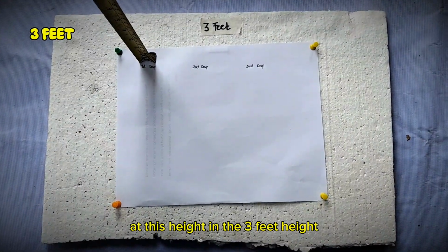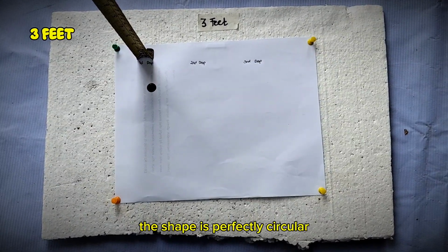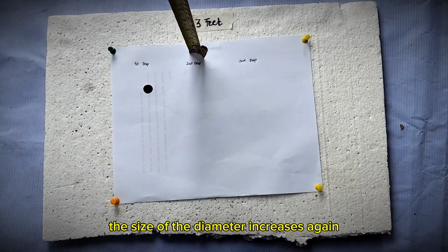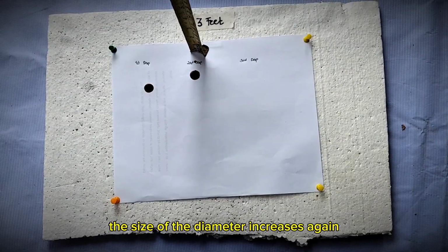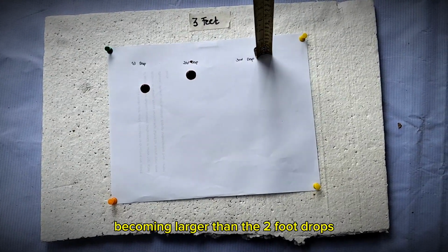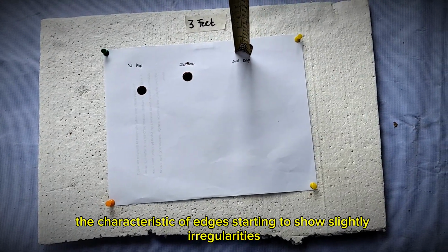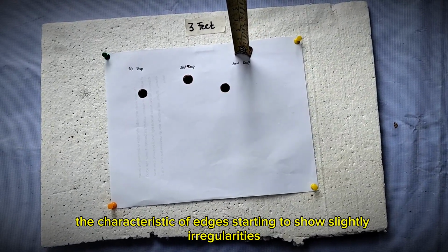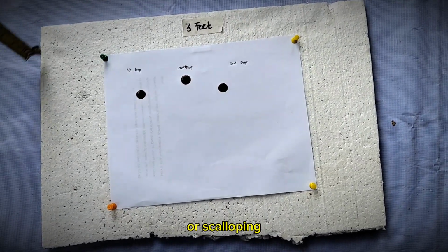At the 3 feet height, the shape is perfectly circular. The diameter increases again, becoming larger than the 2 foot drops. The edges start to show slight irregularities or scalloping.